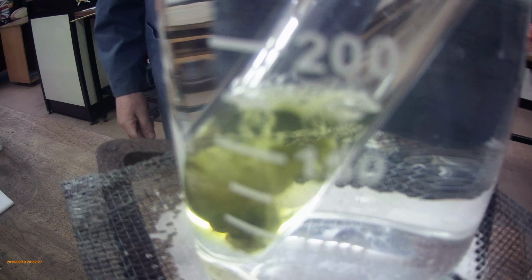Now this is actually perfect. It's exactly what I want to see. And you can see that the water around the outside is not boiling, but the ethanol inside is boiling. We've reached its boiling point. It's beginning to work nicely on the leaf. Green chlorophyll beginning to dissolve into the solution there, and the leaf will start going a little bit white. Another minute or so, and then we'll move on to the actual test for this.